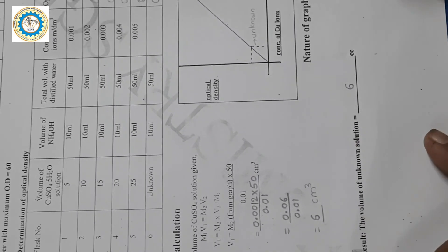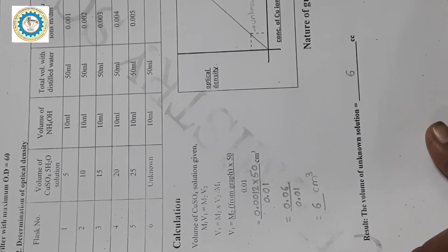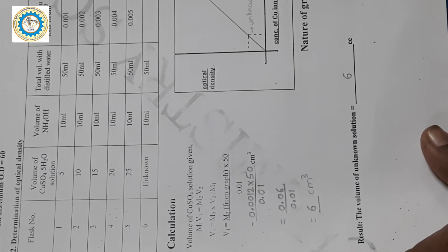This is how we calculate the concentration of copper using the colorimetric method.